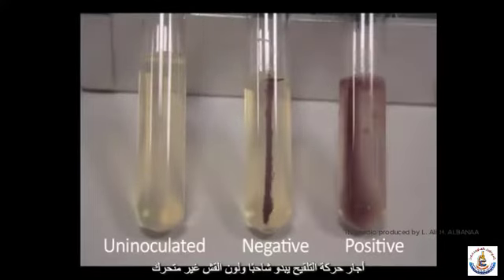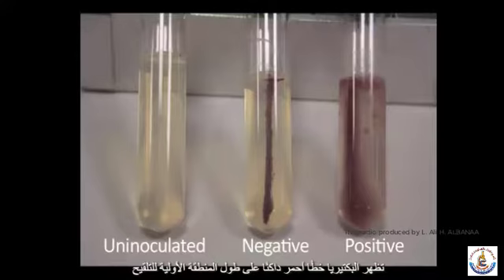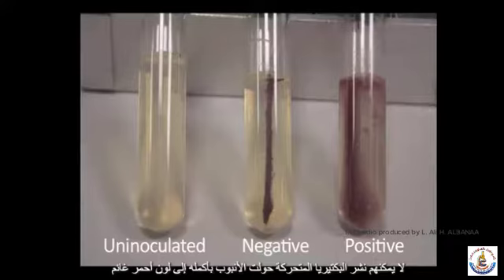Possible results. Uninoculated motility agar appears pale and straw-coloured. Non-motile bacteria appear as a dark reddish line along the initial area of inoculation, as they can't spread out. Motile bacteria turn the whole tube a cloudy red colour as they move throughout the agar.